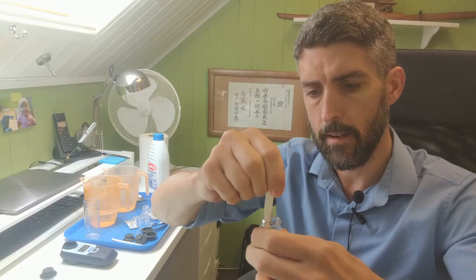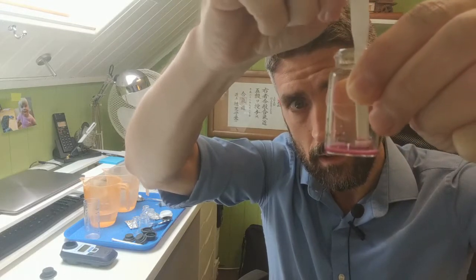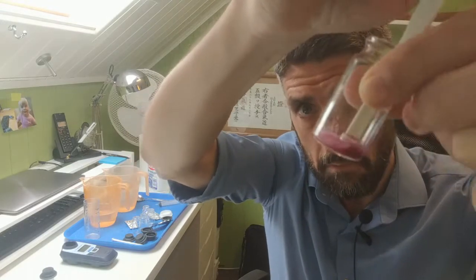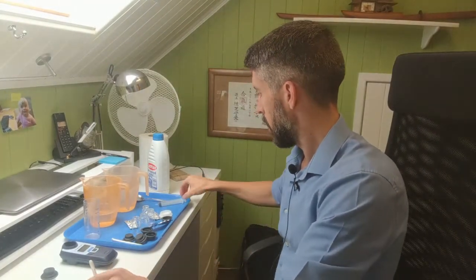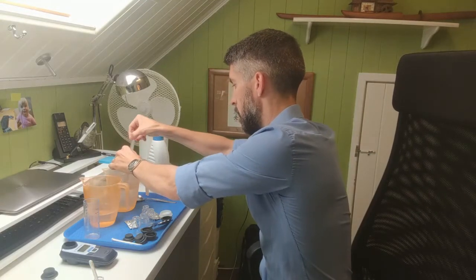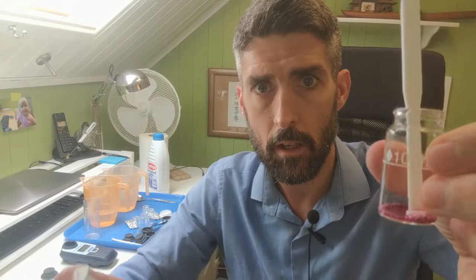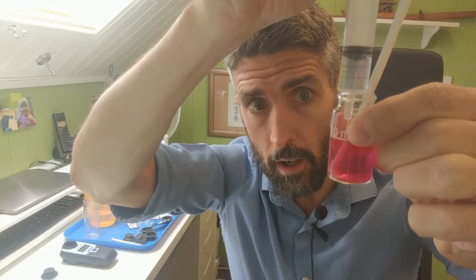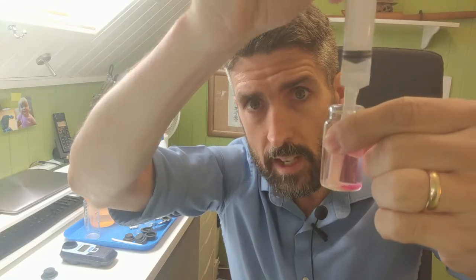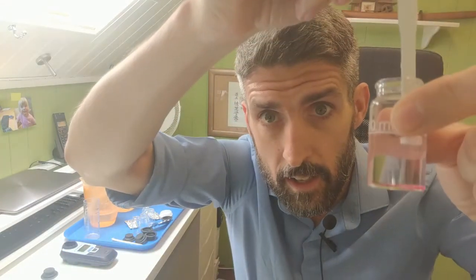Crush the tablet up into just that little bit of water in there. So it's going to be a very, very dark colour. And then what you do is top that up to the 10 ml mark, observing the colour as you do so. And what you'll see, hopefully, is that it's gone clear.